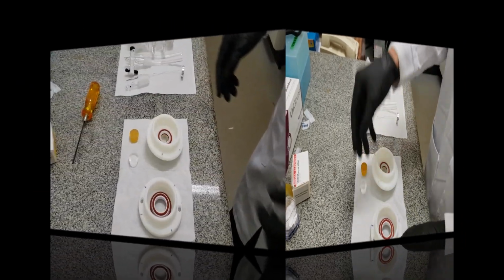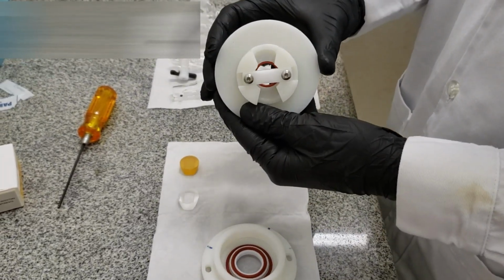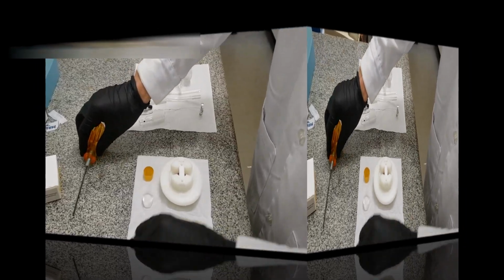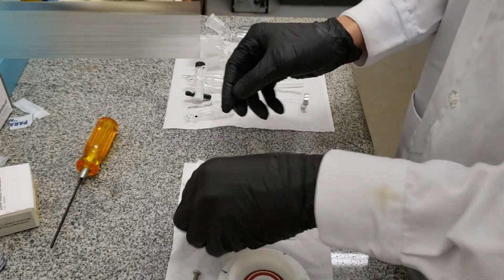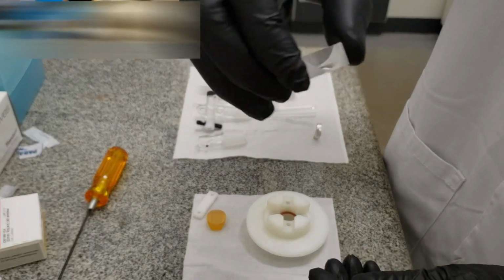In the case of the prism, we also use a Teflon homemade holder. In this case, we are using the calcium fluoride prism, but you can install the zinc selenide or the silicon one, for example, in the same way. As you can see, we use screws to press the prism against the holder.